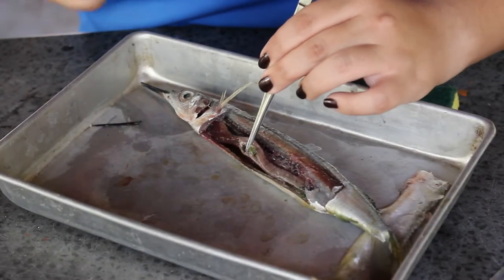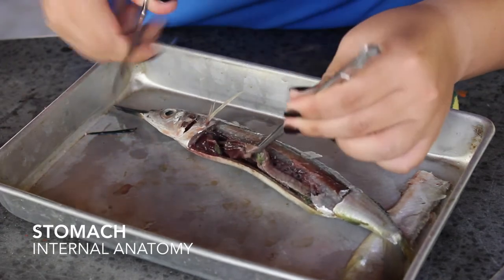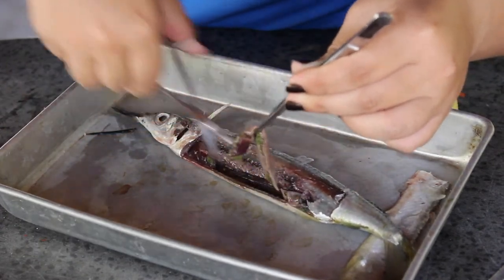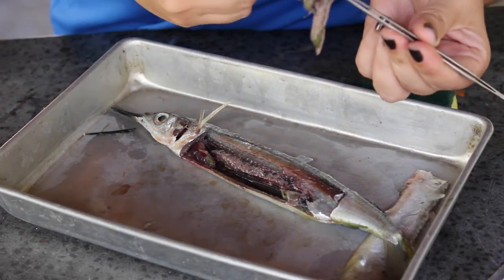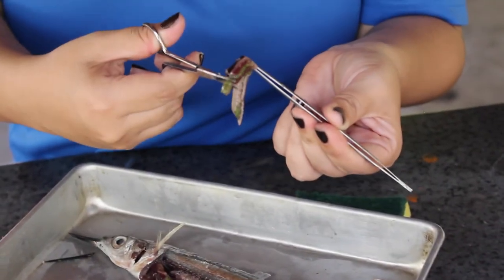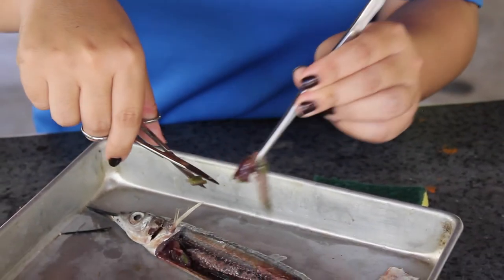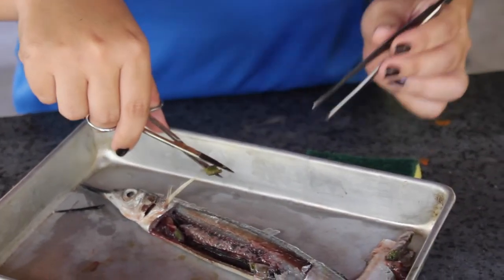Now we are cutting out the stomach so we can see what this ballyhoo's diet consists of. You can already see a little bit of green coming out. This tells us that this is a primarily herbivorous fish. However, they can eat small zooplankton and other larvae species.